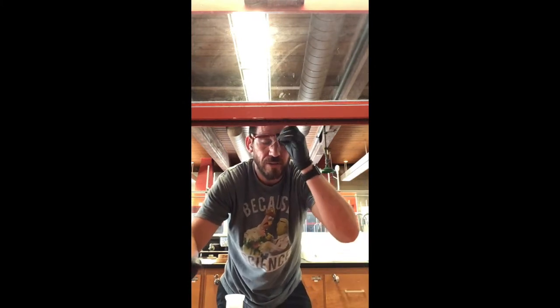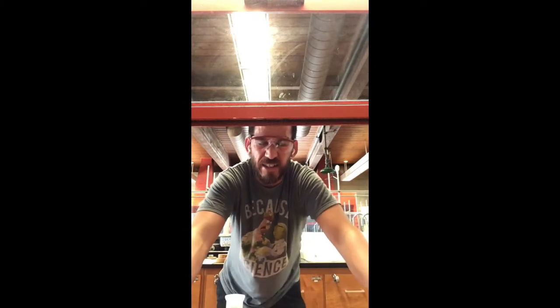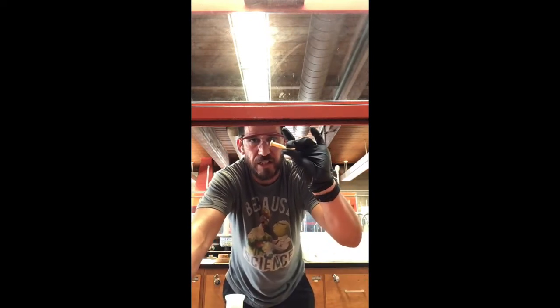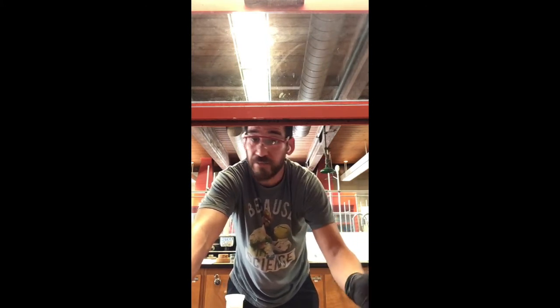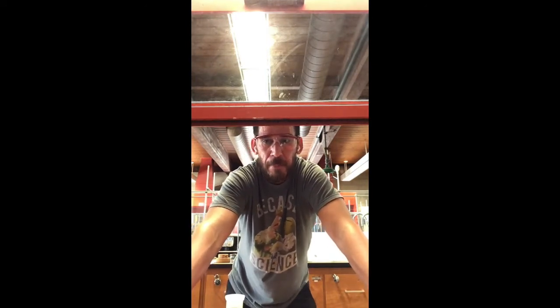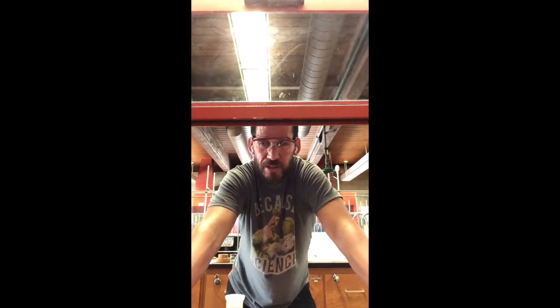That way no chemicals get inside of it and it doesn't get sticky, because eventually what's going to happen is it's going to get sticky and you're going to squeeze it and it's not going to open back up. And that's a useless pipette and you're going to have to get a new one. Or you're not going to know you need a new one and you're going to just struggle with it for a long time and get frustrated with chemistry lab. And it's not chemistry's fault. I'm not going to lie, it's your fault. Because I told you.